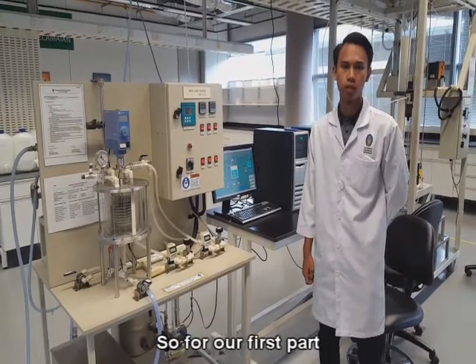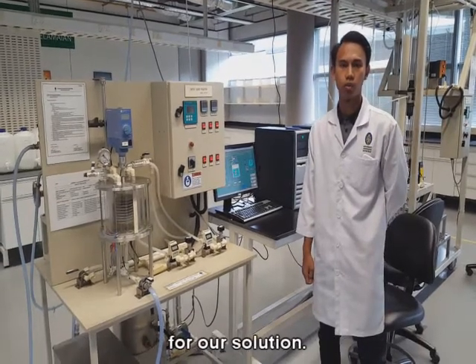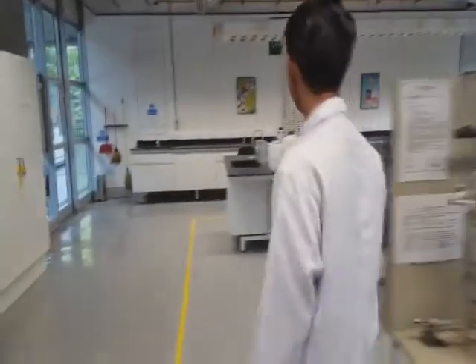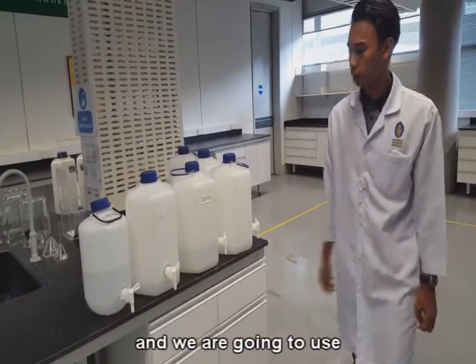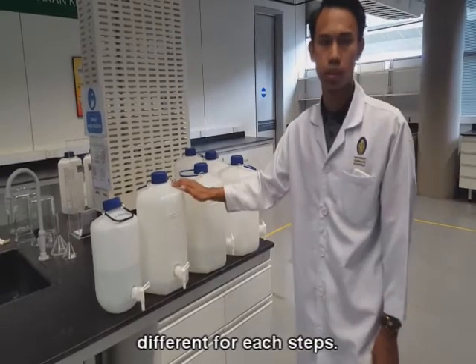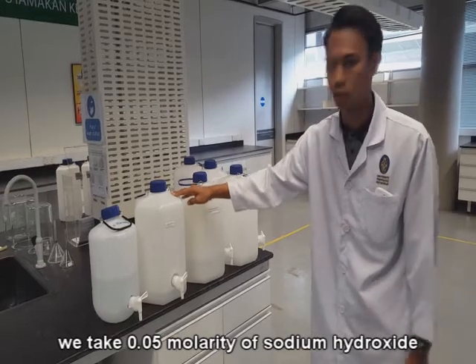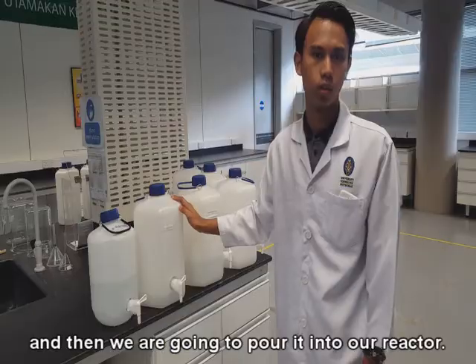For our first part, we're going to use different molarities for our solution. So, let's take a look at the preparation of the solution. Here are the different molarities for our solution, and we're going to use a different one for each step. For example, first we take 0.05 molarity of sodium hydroxide, and then we're going to pour it into our reactor.